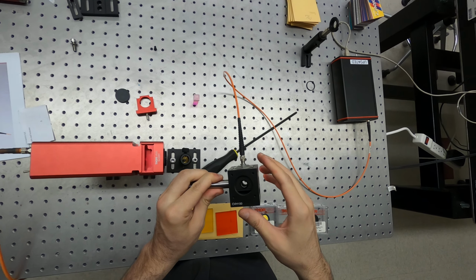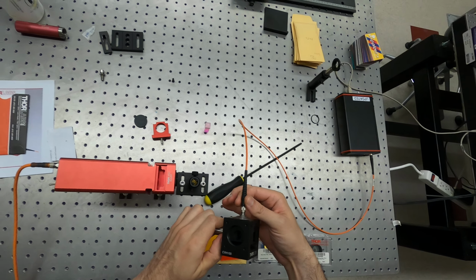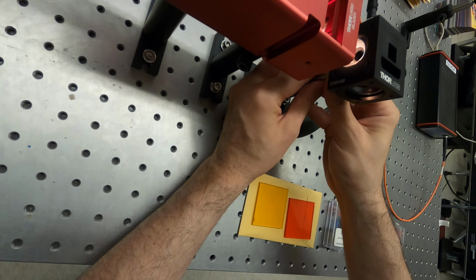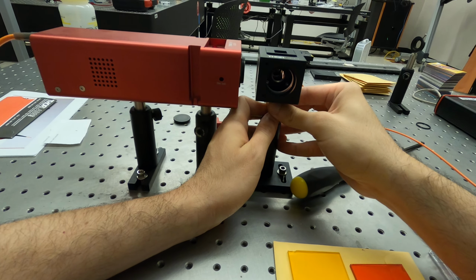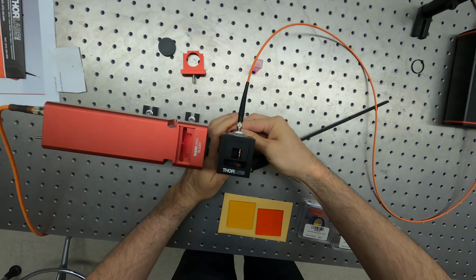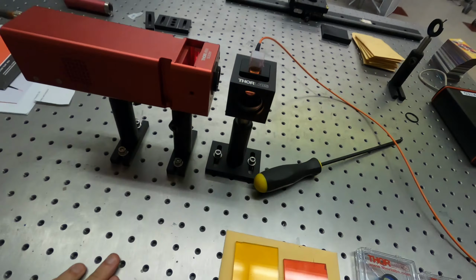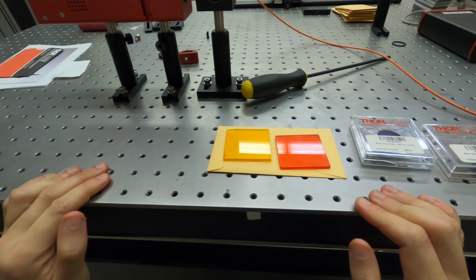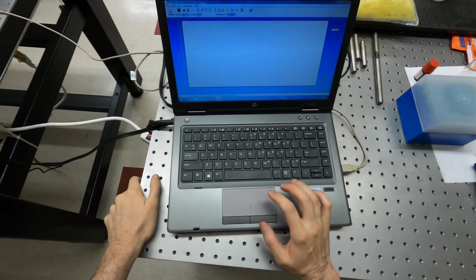So there is an opening in the side, so light can come from the side, illuminate the sample, and the optical fiber will collect the signal or the fluorescence of that sample. So we align here, we make sure that it's aligned at the same height. That looks good. 90 degrees, so we place the sample there. And now you can see a beautiful orange light, a beautiful fluorescence from this laser dye.